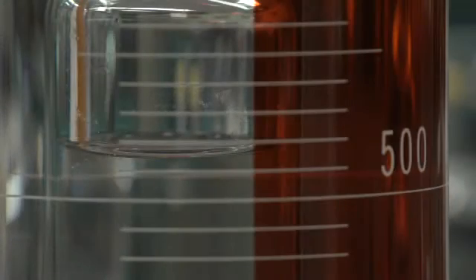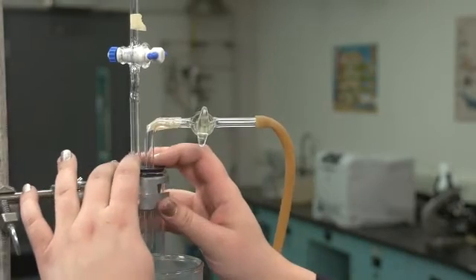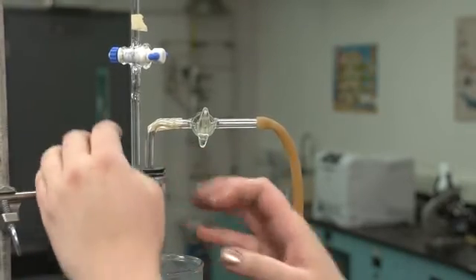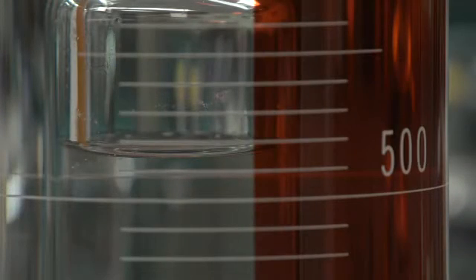Check to make sure the water level is not moving. If it is moving, tighten the stopcock nuts and firmly press the rubber stopper into the apparatus. Check the water level again to make sure it is not moving. You may have to refill the gas in the tube if the water level is above the lower constriction.